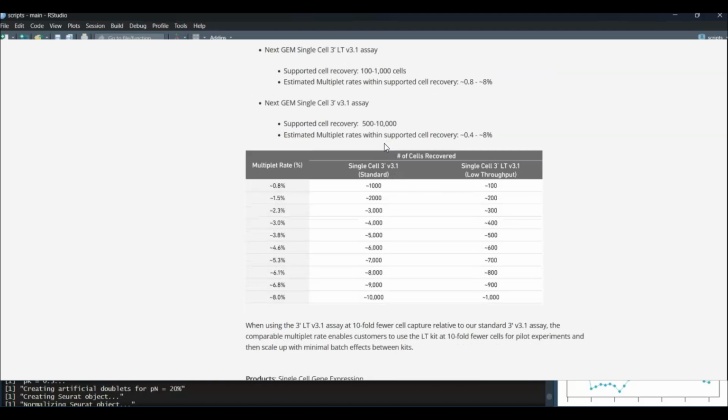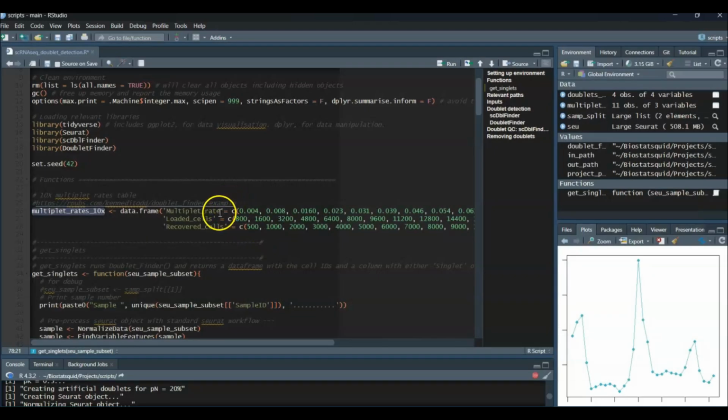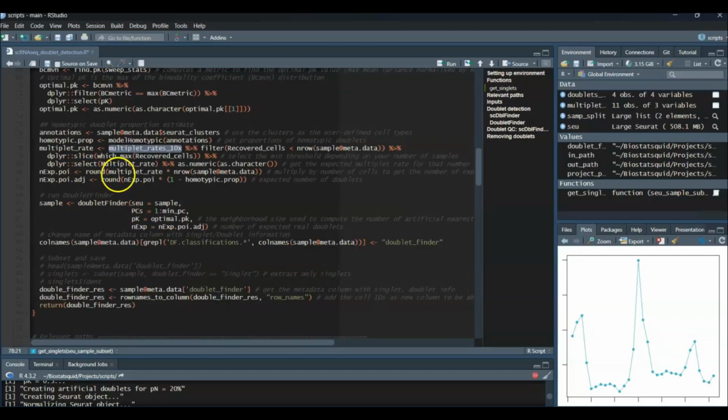So if you're using a different platform, you will have different numbers of expected doublets, or perhaps your sequencing facility already can tell you what the expected proportion of doublets is. Once we have the multiplet rate, we can multiply it by the number of cells to get the number of expected multiplets. The number of doublets is then calculated with the following formula. This one here.